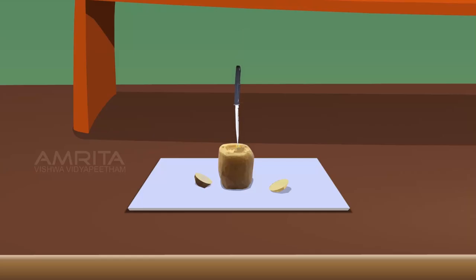Using the knife, make a cavity in the centre of the potato from the flat side almost up to the bottom.